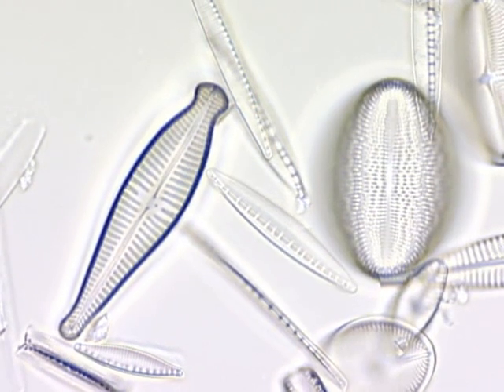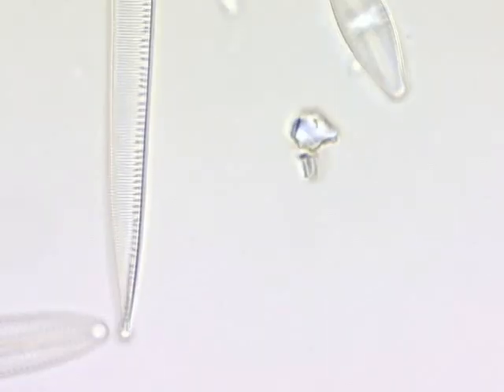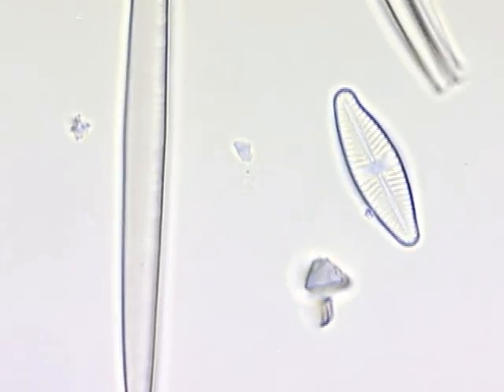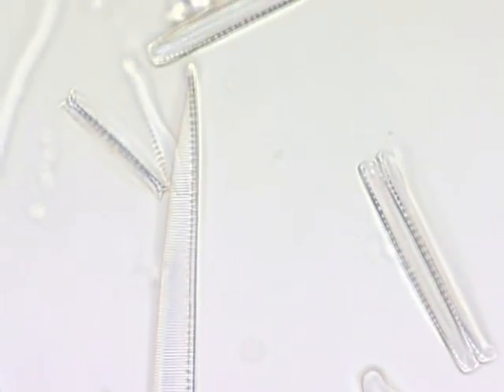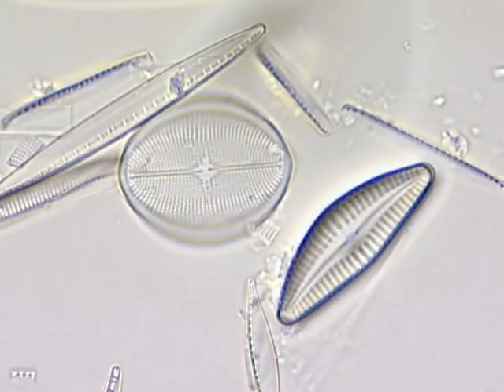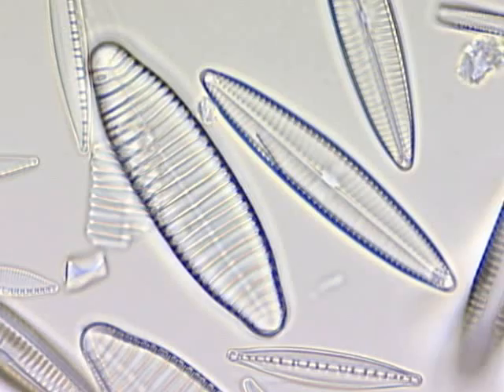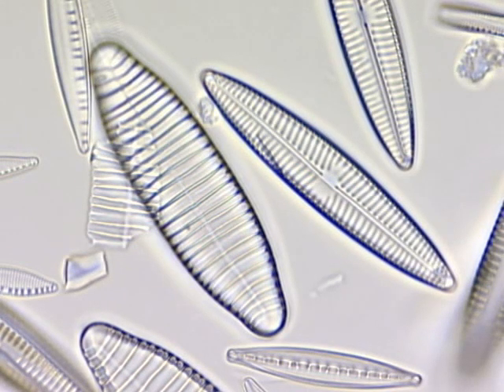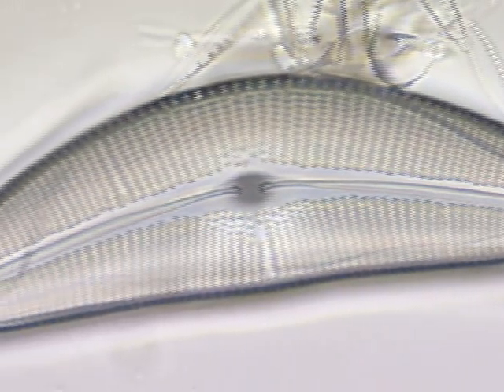Oval, circular, linear, and variously shaped diatoms are found in the clean water sample, quite different from those found in the sample from the severely polluted sewage water. Diatoms can exist in various different aquatic environments, and different species of diatoms exist according to the environmental conditions present.